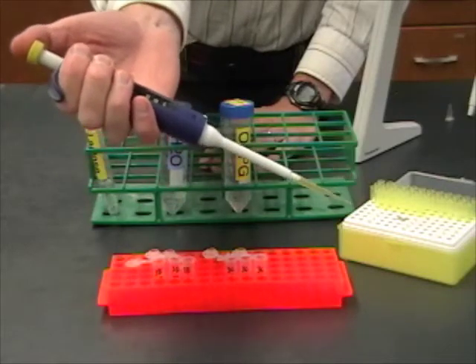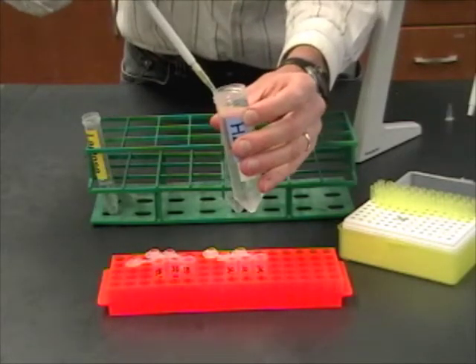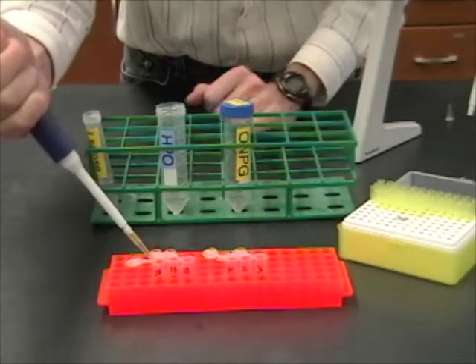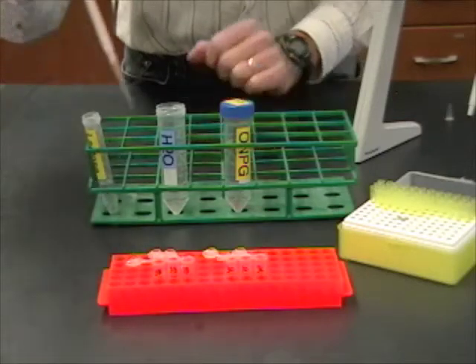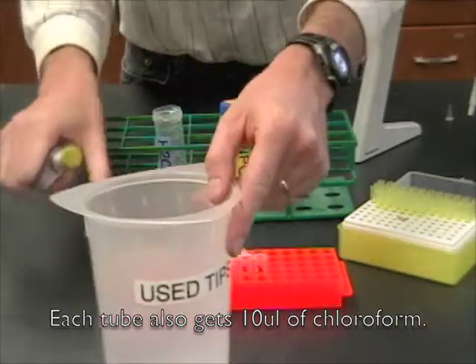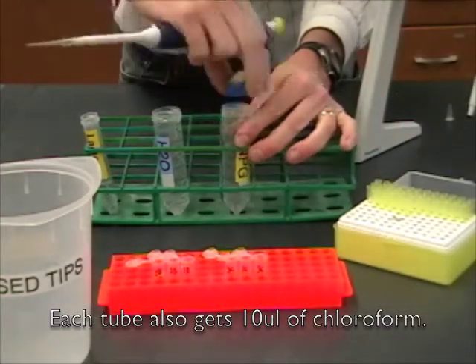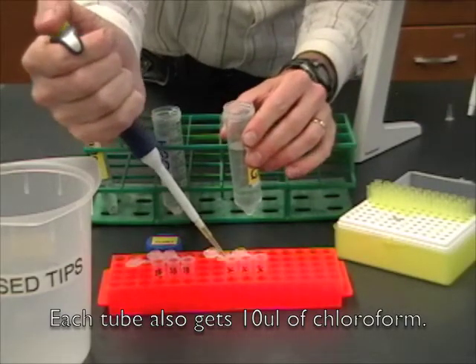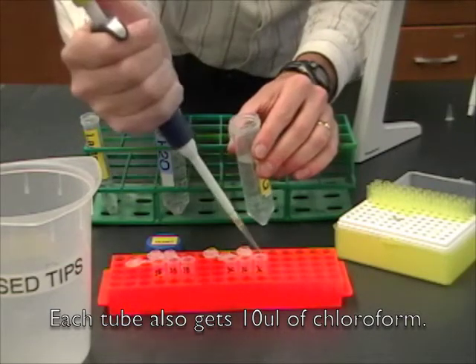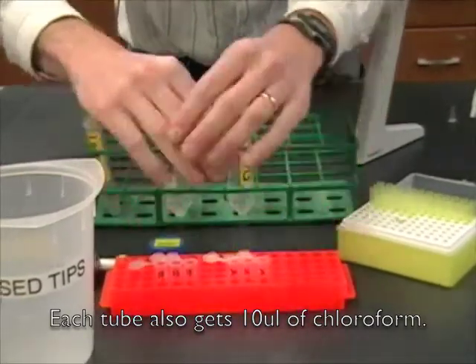And, just a quick review of the pipetter. You just need to tap the tip on. It doesn't have to be hard. Then, to measure accurately, you're going to gently push down with your thumb. Then, pull out the sample that you need. There's 200 microliters of water. And then, go ahead and transfer that to your tube. And, see that I'm putting the tip all the way down in the tube. I'm not trying to drop it up from high. So, we'll do all of these. Now, I'm going to switch the tip when I'm done. And now, my tubes of ONPG. Again, 200 microliters in each one of these tubes. Take your time. And, when you're done, it's good to give them a quick inspection just to make sure they all have the same volume in them and that you haven't missed a tube.